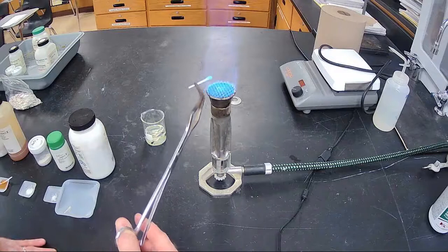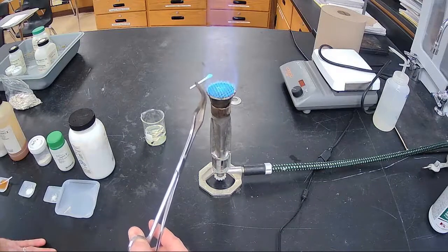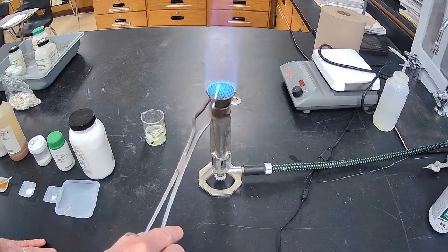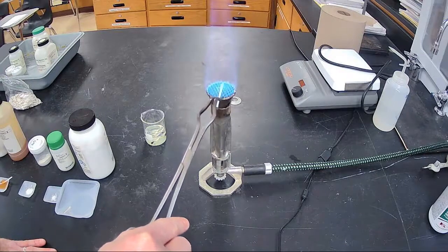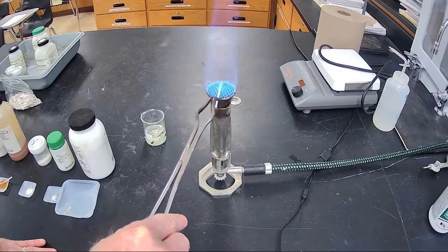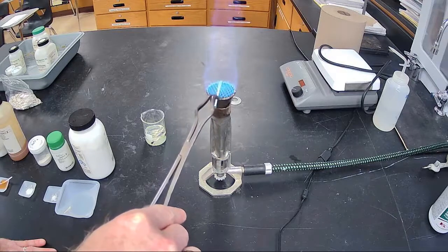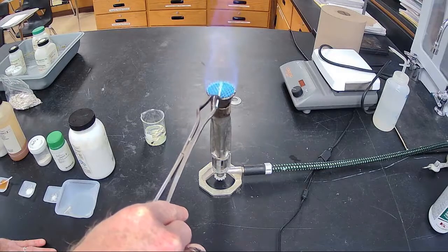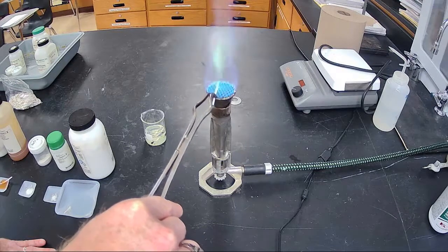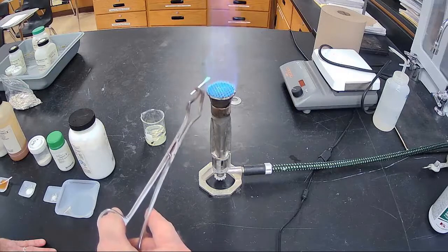We've already done number 3, so we're going to number 4. Number 4 is going to take a second to get going too, because it's in a liquid. It's in aqueous solution. So once it gets going, we have a really good color for this one. And this is salt number 4. There we go. The metals are starting to ignite a little bit. Good color.